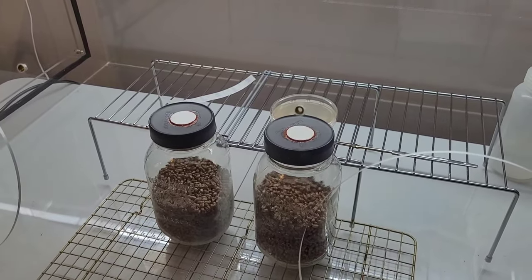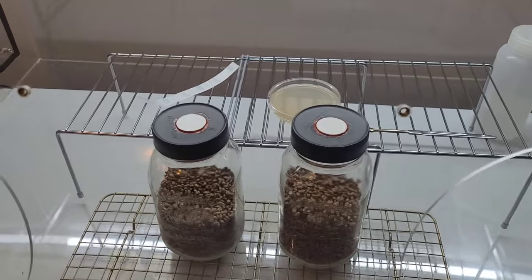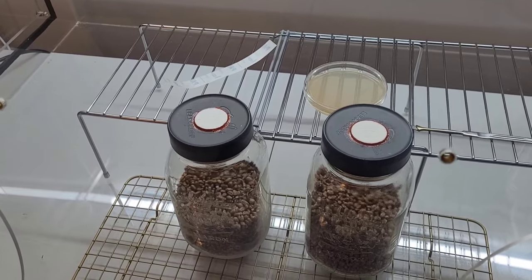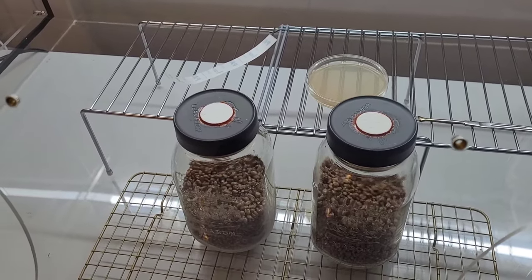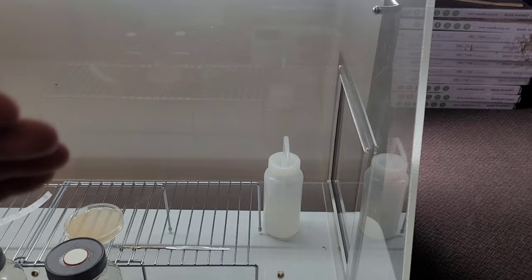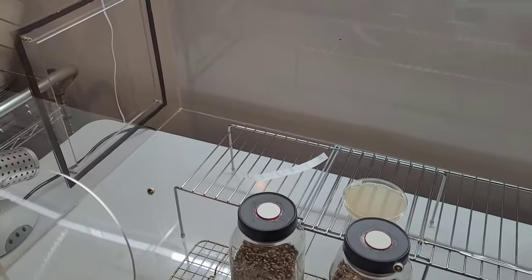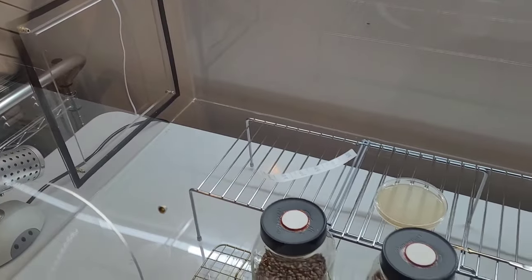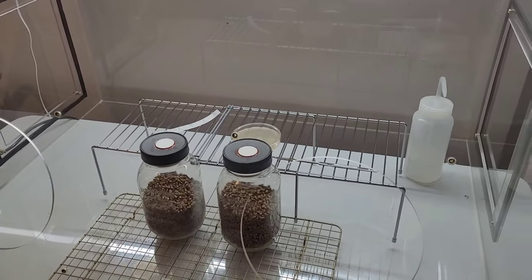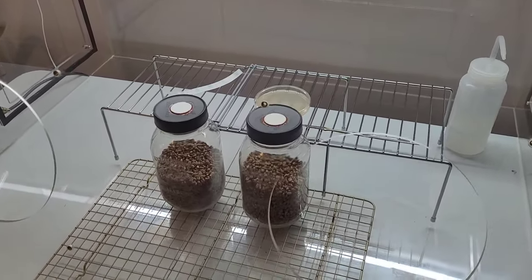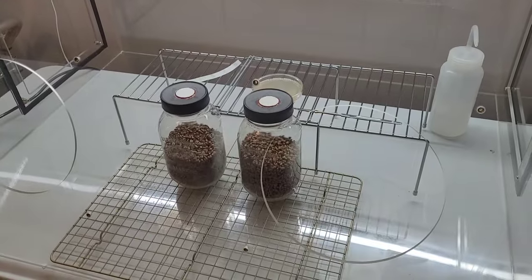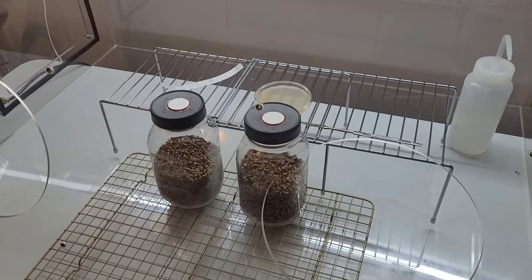So when you think, hey man, maybe I'll turn this still air box into some sort of flow hood contraption, just don't. Even if you were to plug an actual laminar flow machine into this unit, into a still air box, the geometry of the box automatically, with all of these right angles, even if they were rounded, would produce turbulence. So right away your laminar flow has become turbulent flow, chaotic flow, which defeats the purpose of laminar flow and at the same time defeats the still air found within your still air box. So it's a two-for for stupidity. Don't do it.